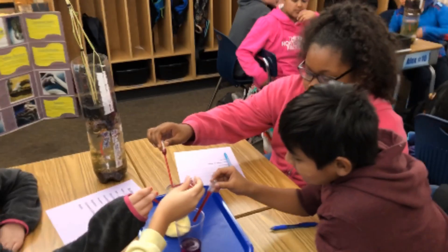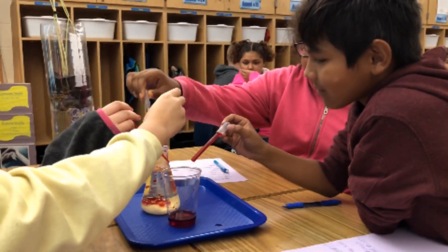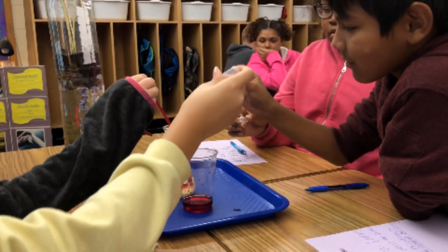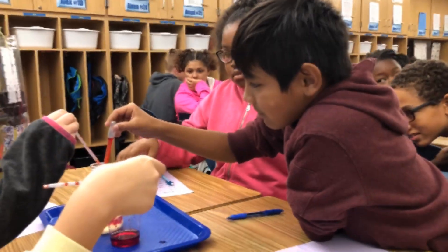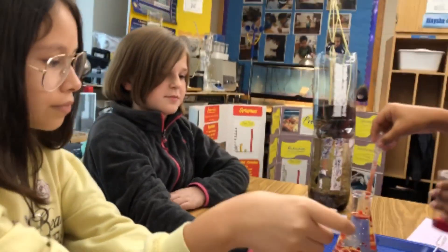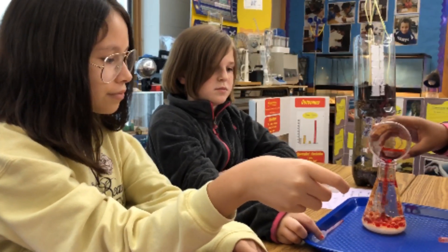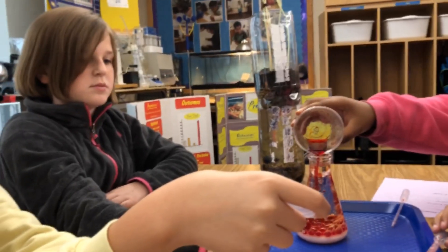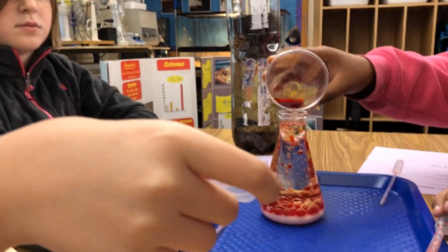Add your catalyst and see what happens. Oh — a red lava lamp! Good job. Add your drops of acetic acid. Nice job. Let's see some of those bubbles rise.